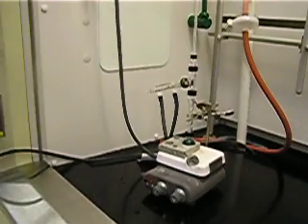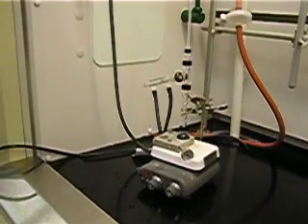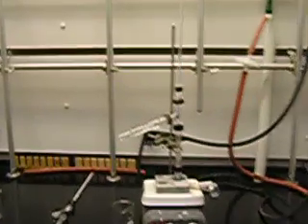And that is the setup of our fractional distillation. About 15 to 20 minutes later, our fractional distillation apparatus should look something like this, in which we see that our solution is distilling, and that drops are falling from the side of the jacketed condenser into our beaker.